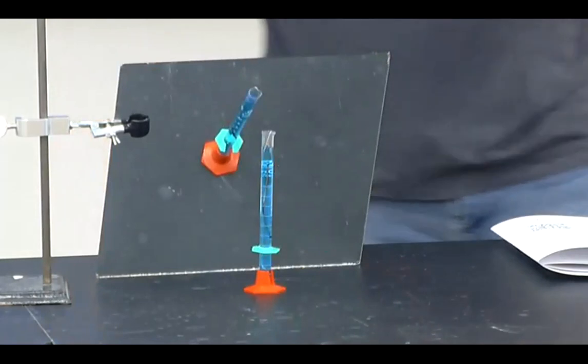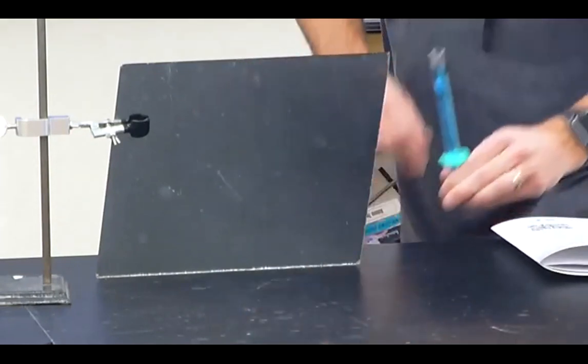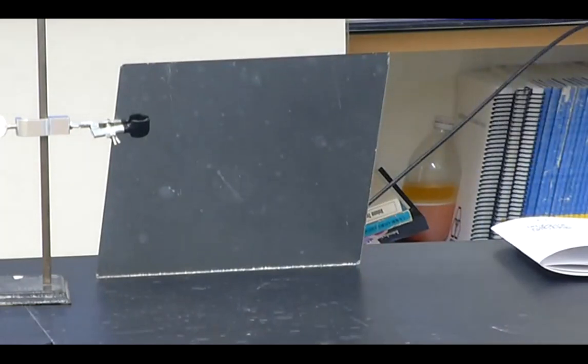You can't see a ton until I walk around. You can't even see it at all. So Tanner, sorry, I'm just going to walk around so people can see it a little bit better. All right, so you can see it's definitely changed color. I'm going to put it back in. So definitely changing color. Kind of blackish, almost a little bit starting to turn brown.